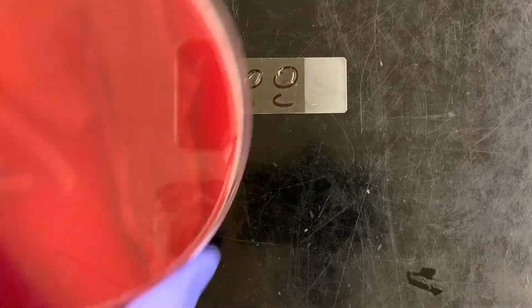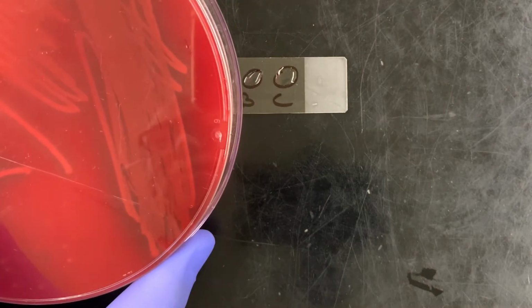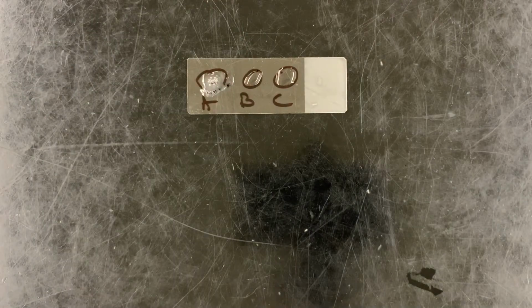That said, we cannot rely on this, because there are many bacteria that are catalase positive that are not staph, and there are many catalase negative bacteria that are not strep. So what's implied is that I would have grown this bacterium on various media and taken it under the microscope, and I would have said, this looks an awful lot like staph. I just want to make sure that it is indeed staph, so I do a very quick catalase test, and that helps me with my assessment. We very rarely rely on one single piece of data, and that's always going to be the case.